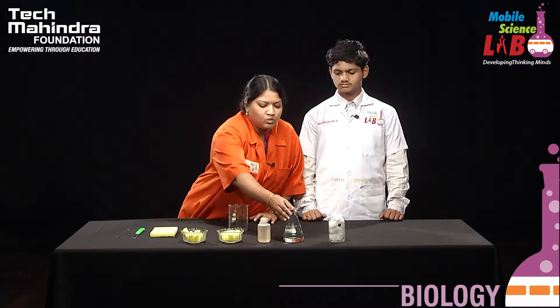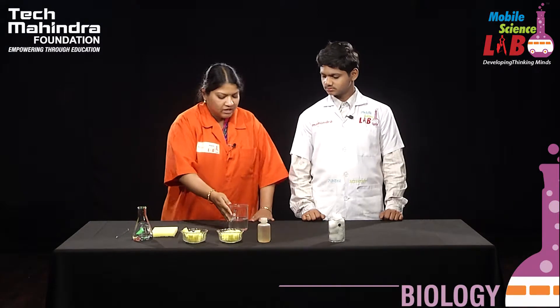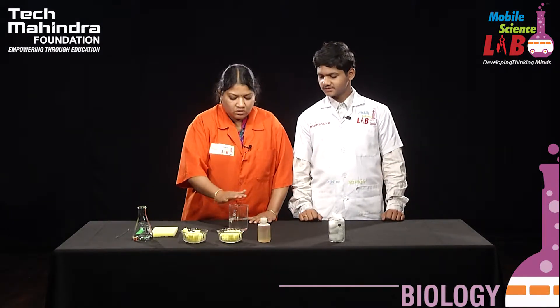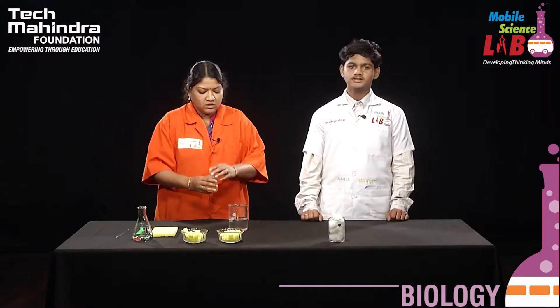In the atmosphere there are many harmful substances mixed with useful substances. Water is a universal solvent and is very useful for everybody, so water is our useful sample today — clean water that we can drink. Now suppose it is mixed with some oil.